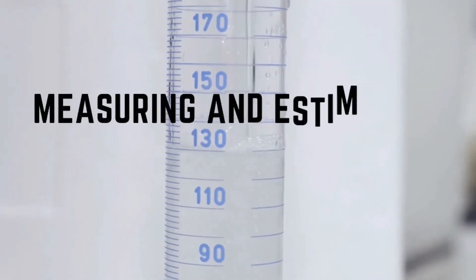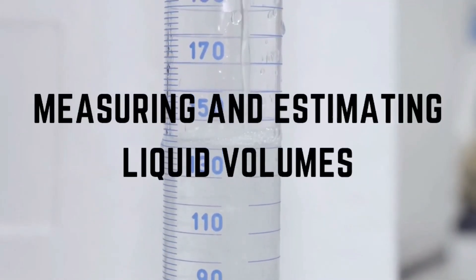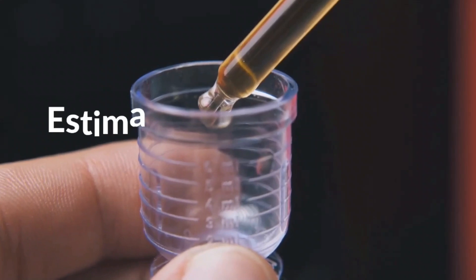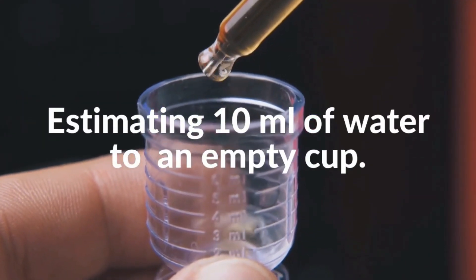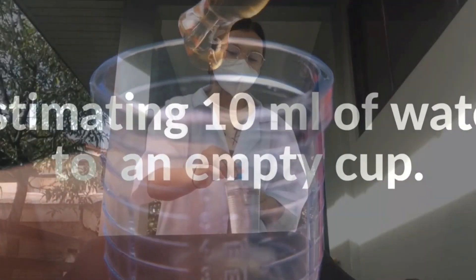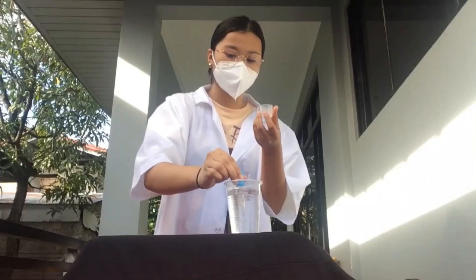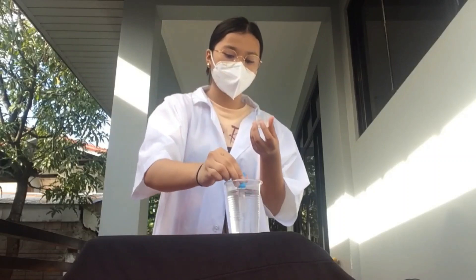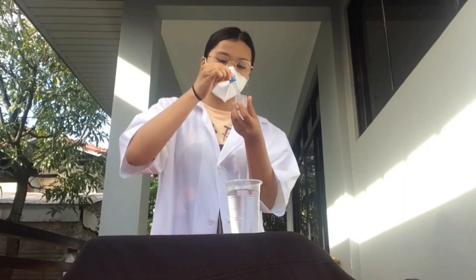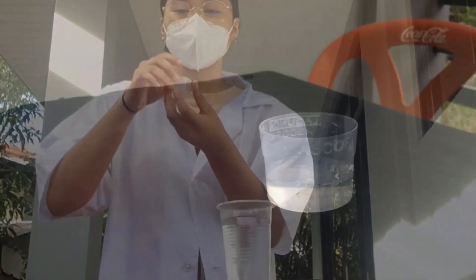The first process is measuring and estimating liquid volumes. We will first estimate 10 mL of water to an empty cup. In this process, I use a cup, a cup full of water, and a medicine dropper. I look at the lower level of the meniscus where it gives the accurate measurement of the volume.